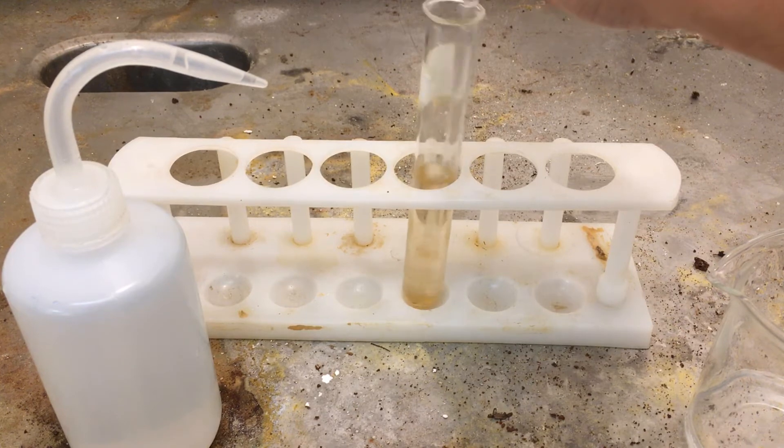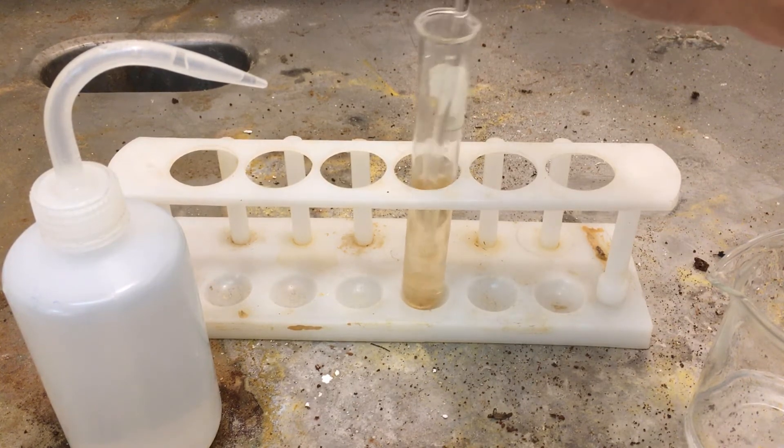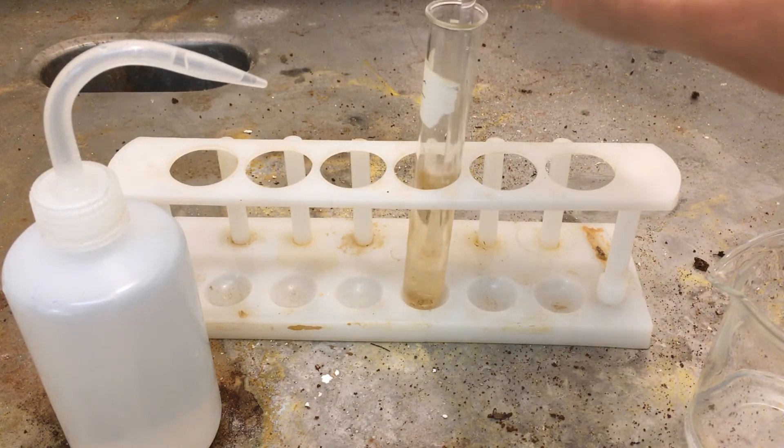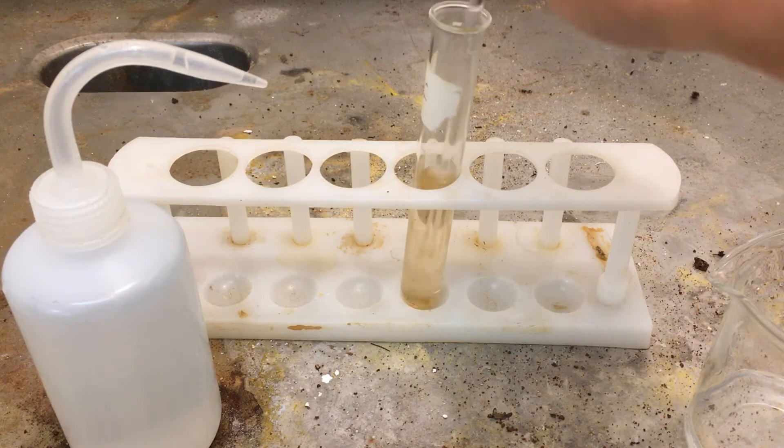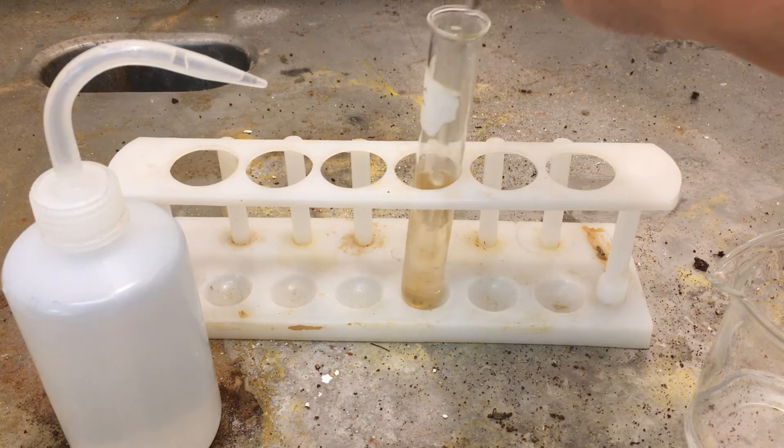I'm trying to dissolve some of that iron 2 plus. The iron 2 plus is actually being complexed with the water, so we're forming the hexa aqua iron 2 ion.